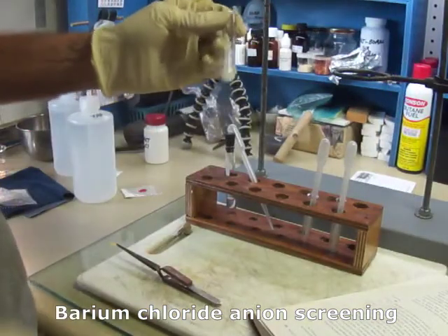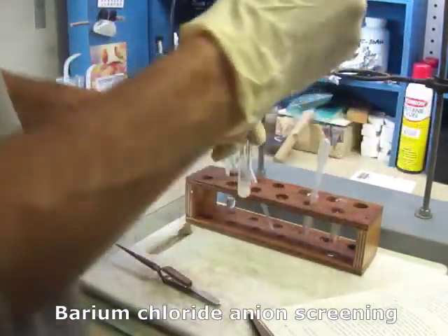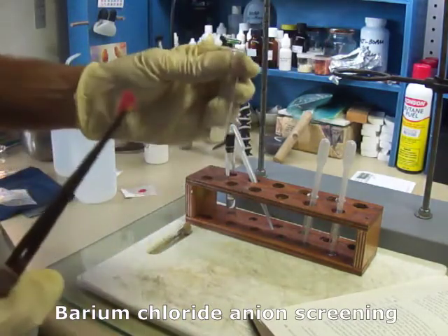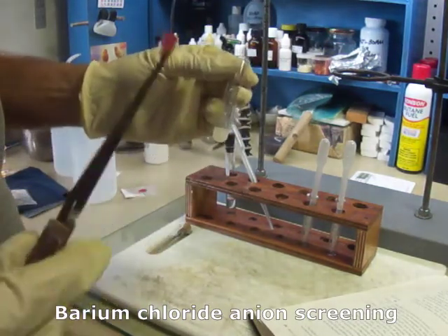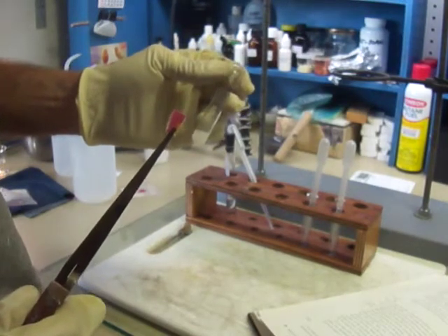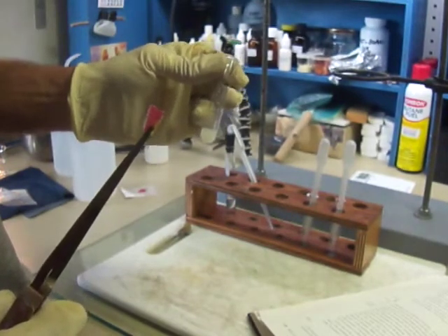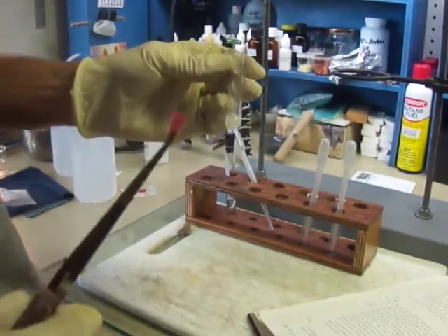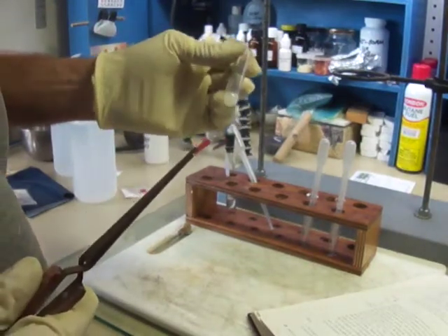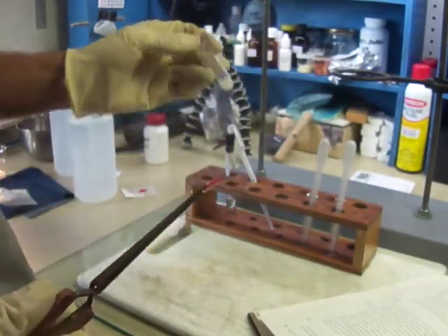Now we make this acidic with 2 molar hydrochloric acid. Okay, so that's acidic. The book tells us that if the precipitate dissolves completely, the absence of sulfate is proved, but if it is not completely dissolved, the presence of sulfate is proved. So I guess this screening method actually gave us the answer here. It narrowed it down to sulfate.